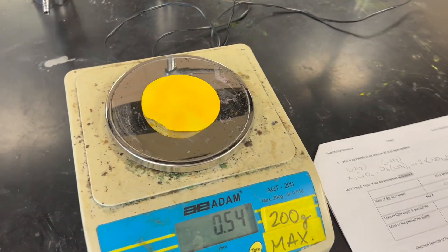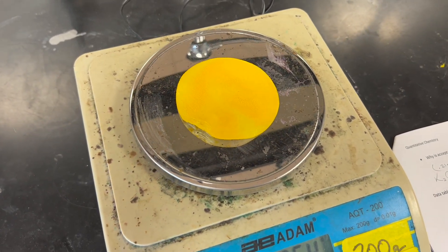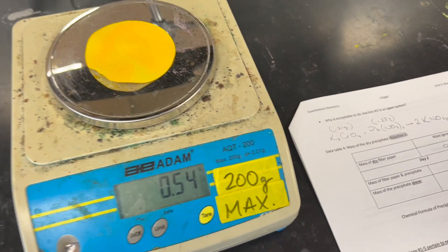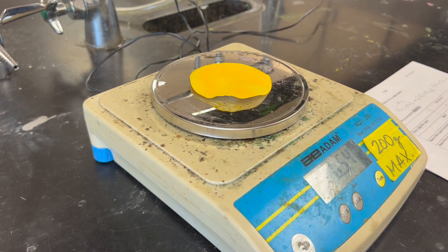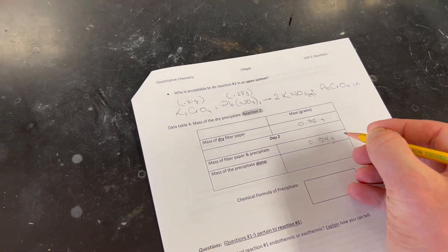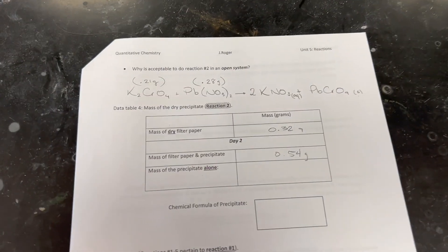Now that our filter paper and the precipitate are dry, we can finish up the lab by recording 0.54 grams in our data table. That would be the mass of the precipitate and the mass of the filter paper combined.